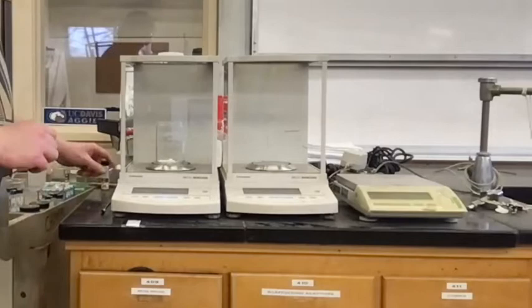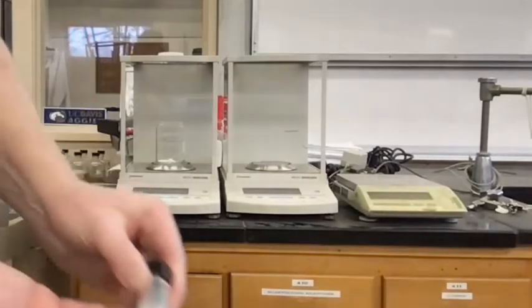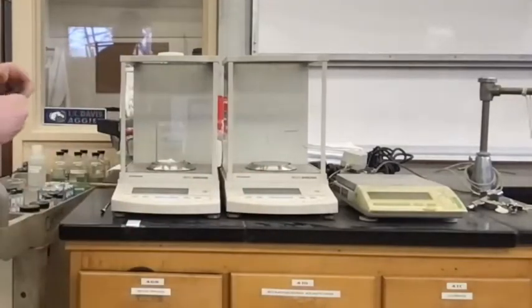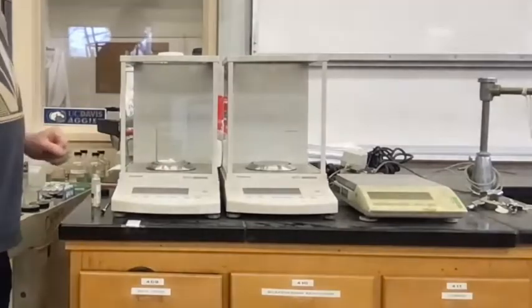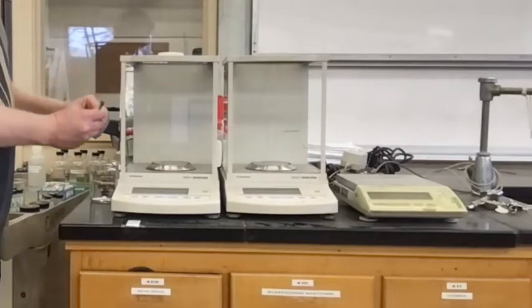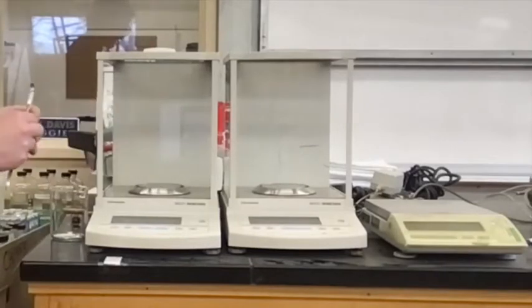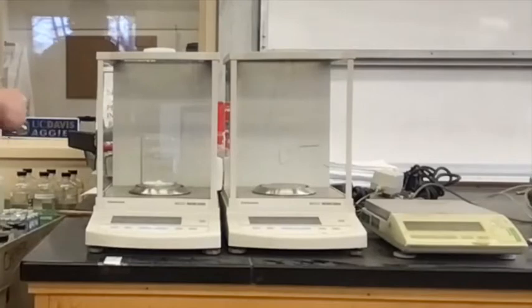Next up, I have my acid. It's either an acid or an amine. It's a kind of off-white solid, a little bit yellow. And I want to tare this now, so I start back at 0. Then I'll add about the same amount, about 0.4. That's 0.14. 0.24. Okay, we'll go with that.